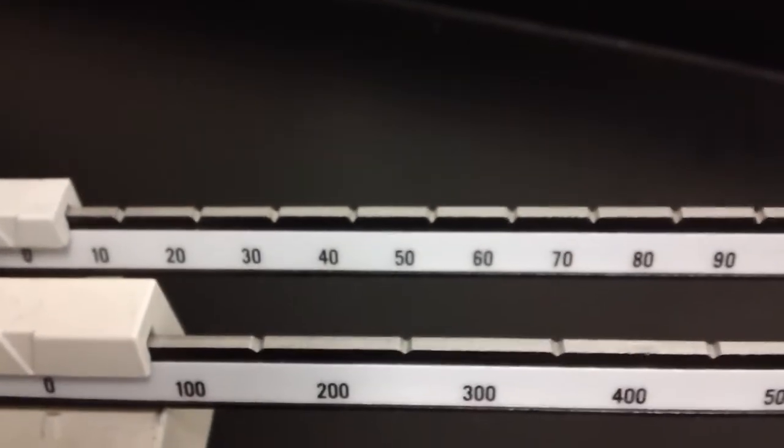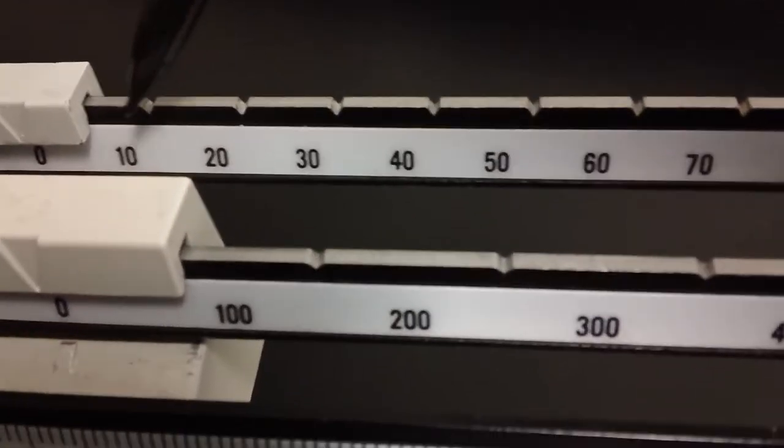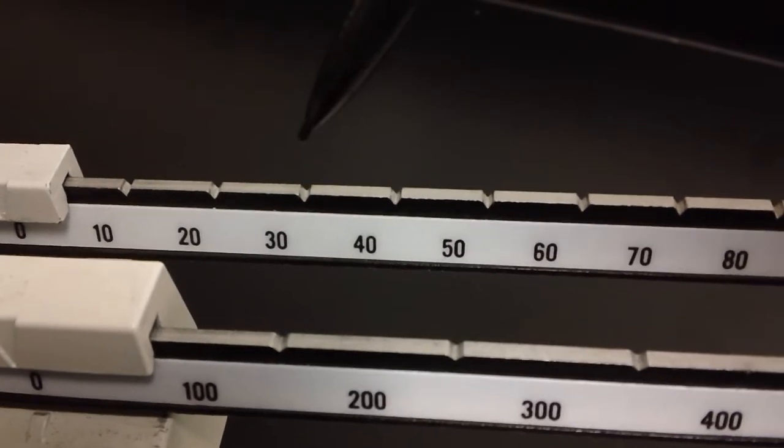If I go to the back arm, this is broken down into tens of grams, so this would be ten grams, twenty grams, thirty grams, et cetera.